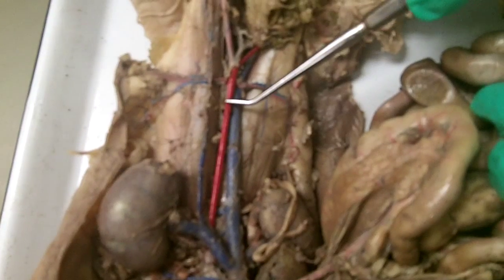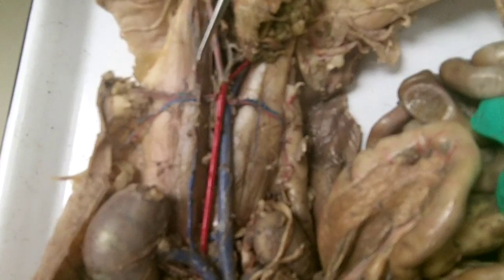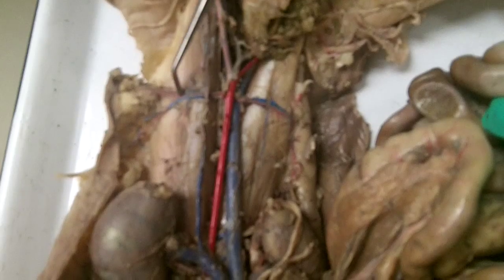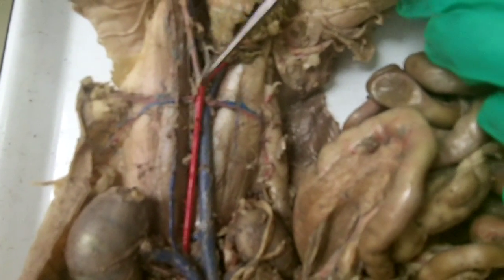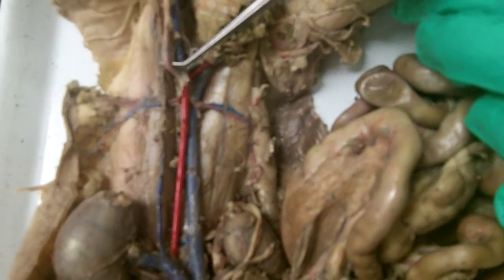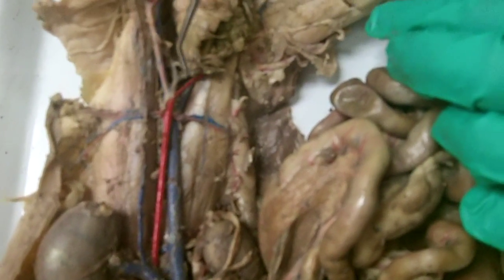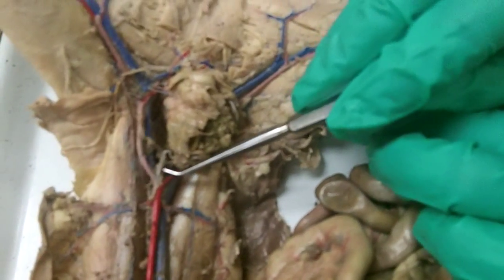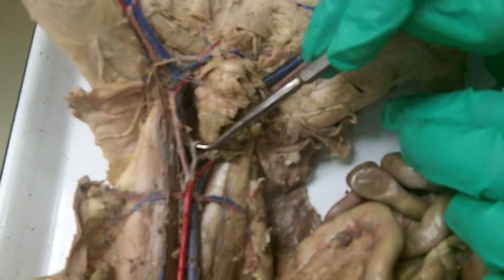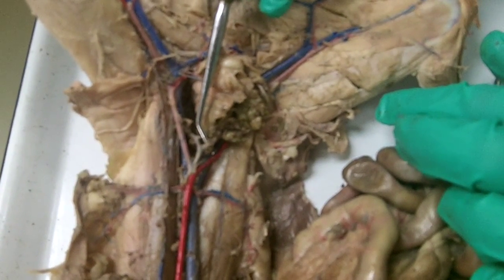This is the inferior mesenteric artery, and it serves the large intestine. Then the next vessels you see in red are the iliolumbar arteries, left and right. And then we get to the iliac arteries. Now, here is the left external iliac and the right external iliac. And then this centerpiece right here is the internal iliac, which further bifurcates into the left and right internal iliac.